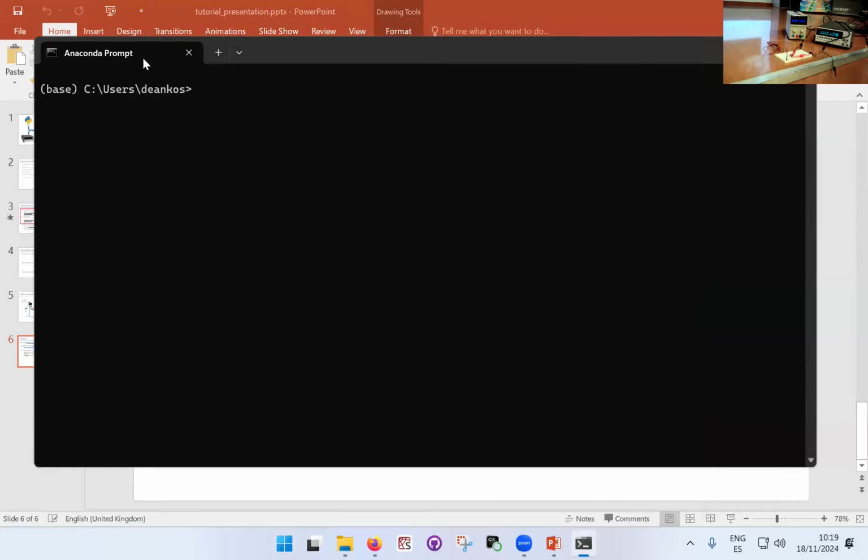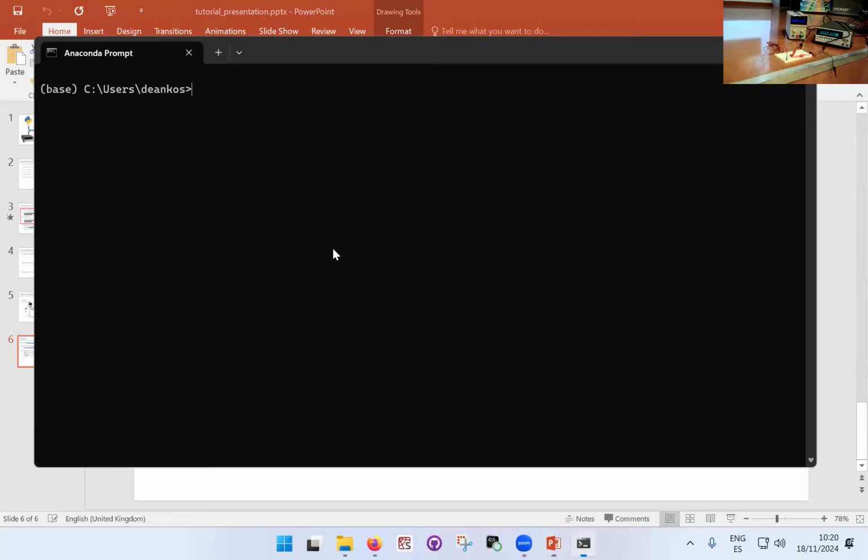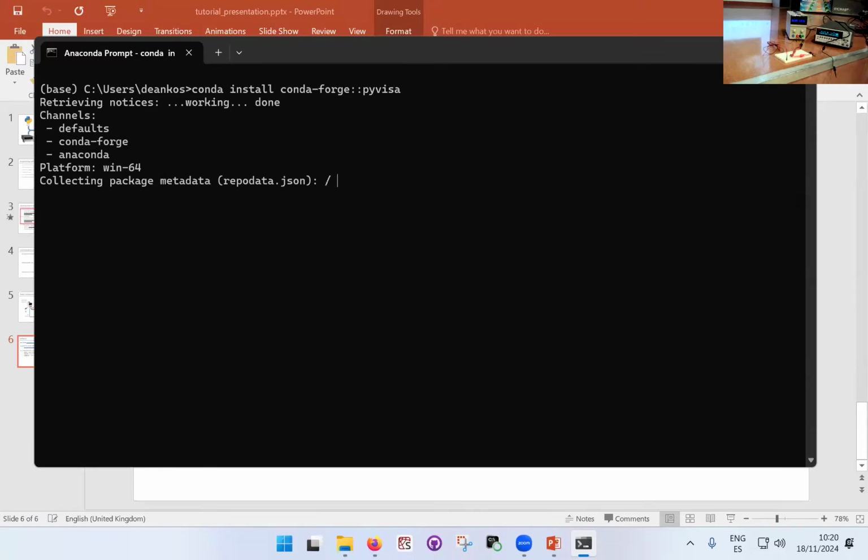Once you install Anaconda, in here you would type the messages that we had a look at here. So, for example, you would type this message in. Now, I actually haven't run this Anaconda prompt through with admin privileges, so it will complain. But generally, it will list some text, and it will figure out the compatibility with other packages. At some point, it will ask you if you want to install the package or not, and you just press yes, and that's it. So with this, you will basically be ready to program everything.